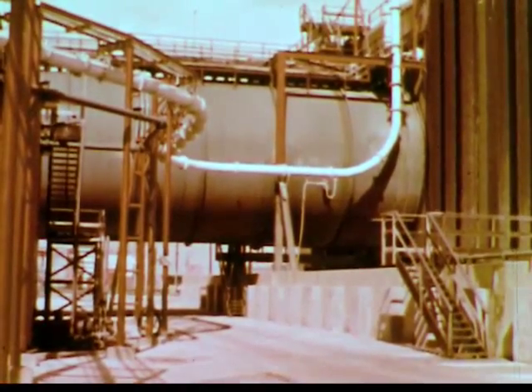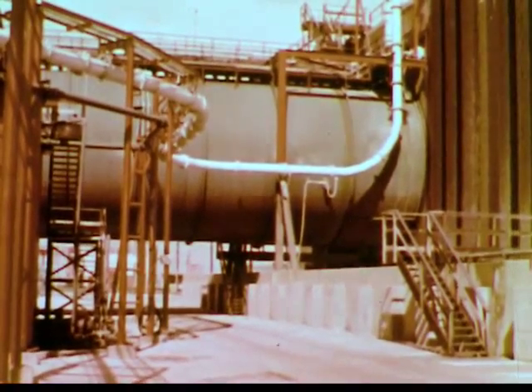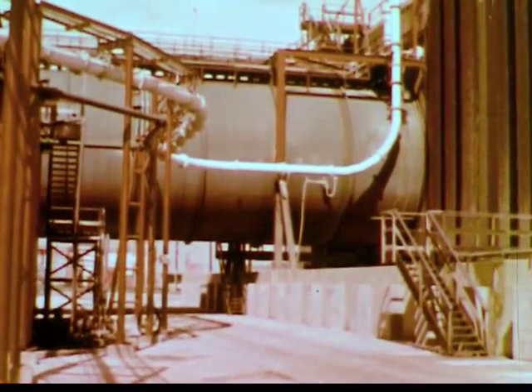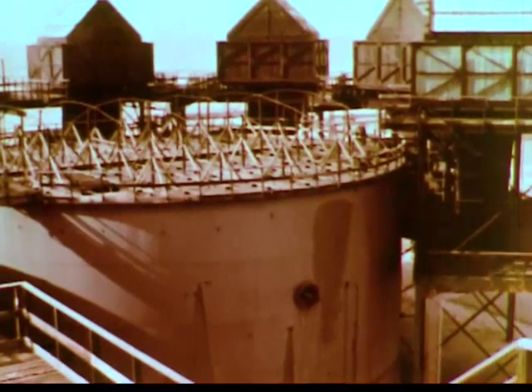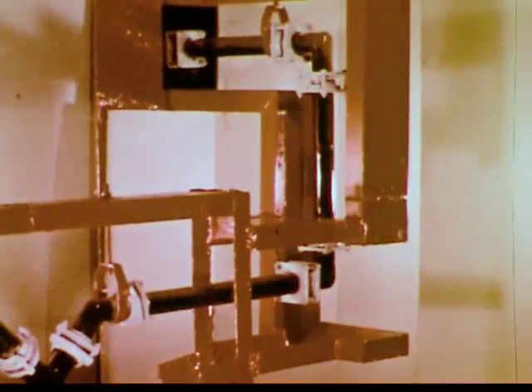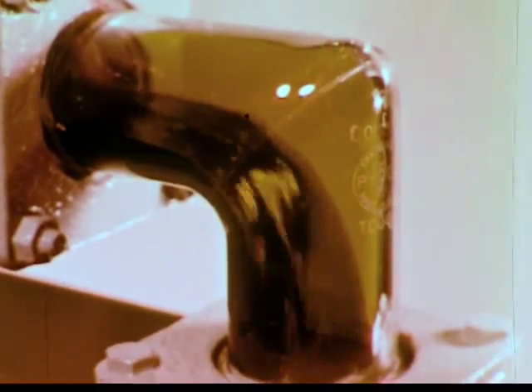The air and bromine vapor leave through this large green pipe. The small white pipe introduces sulfur dioxide gas to reduce the bromine vapor. The hydrogen bromide which is formed is concentrated in this absorption tank by dissolving in a falling spray of water. The concentrated hydrogen bromide solution then enters this tower, and chlorine is added to reoxidize the bromide. Steam is used to distill bromine from the solution. The bromine is then condensed to a liquid which can be stored for later use.